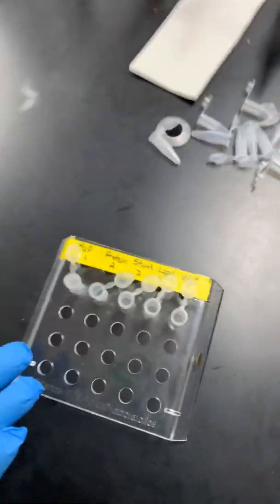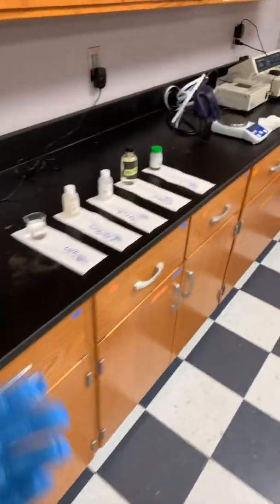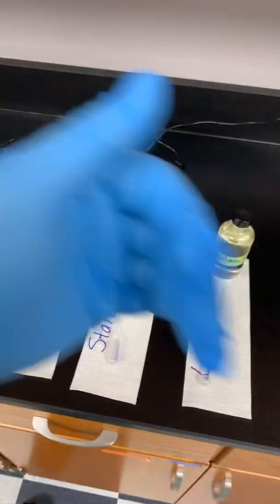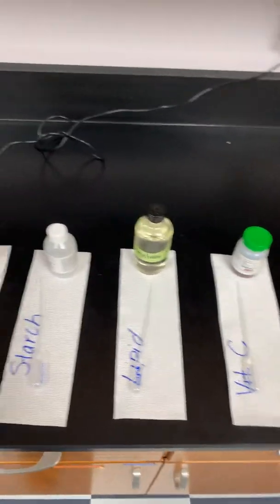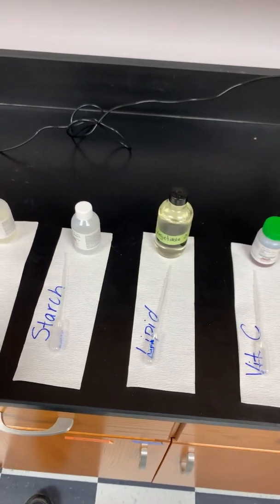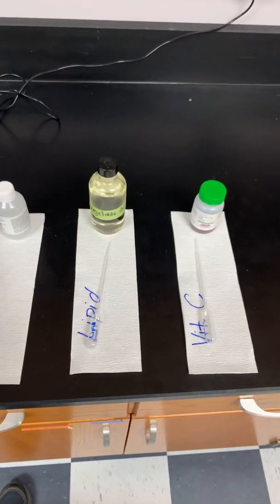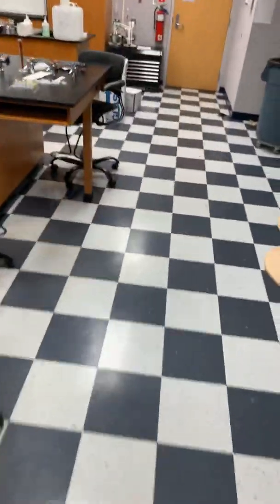So I just did the one, I just did the water. You'll do the same thing for your protein, your carbohydrate, your lipid, and your vitamin C. So again, you'll transfer these into the corresponding tubes in your rack. So again, the same thing here, hold it firmly, depress all the air, release and draw it up till you get to 1 mil, put that in your tube, go back in here, squeeze all the air out, go down below the liquid, release it up to where it's half a mil, put it in your tube, and then when you're finished, you should have a nice full test tube.